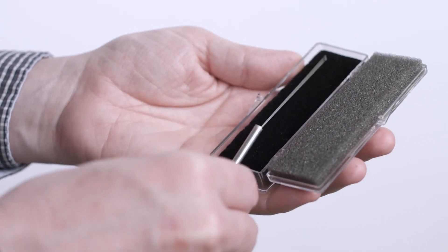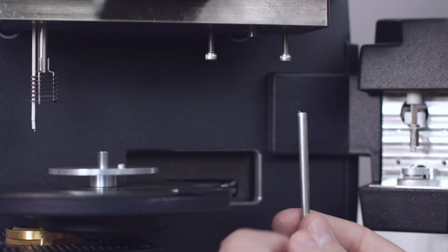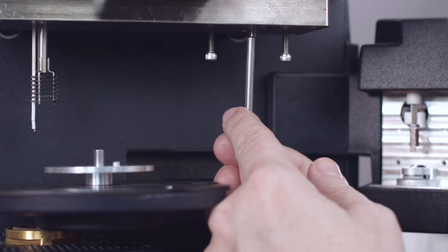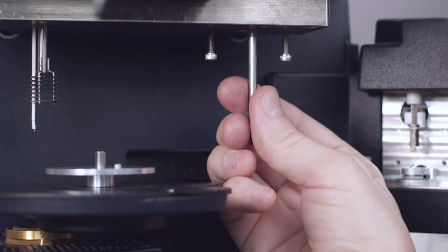Insert the new hang down wire into the tool the same way as before. Insert the tool with the hang down wire into the opening and push upwards until the hang down wire is visible from above.